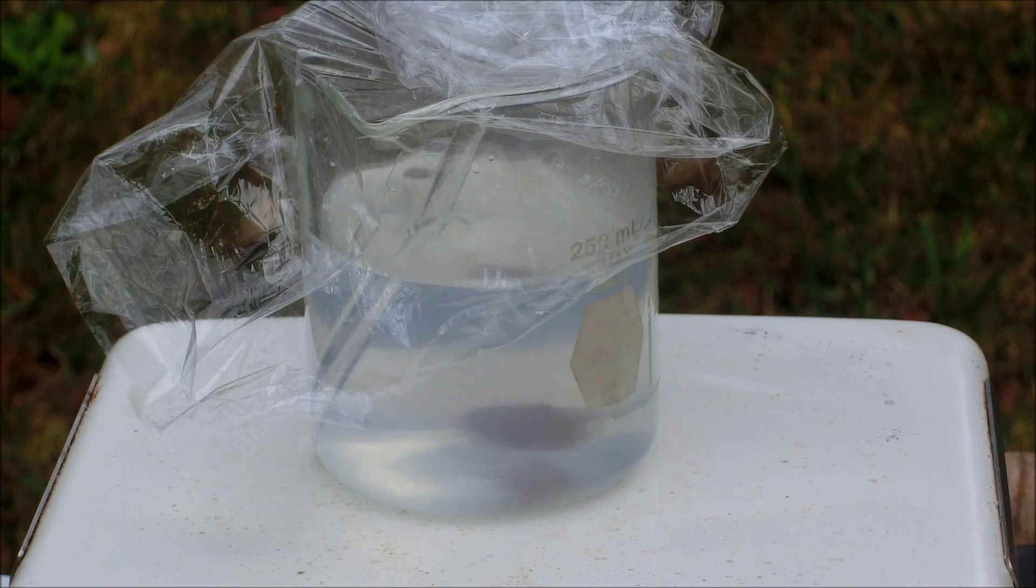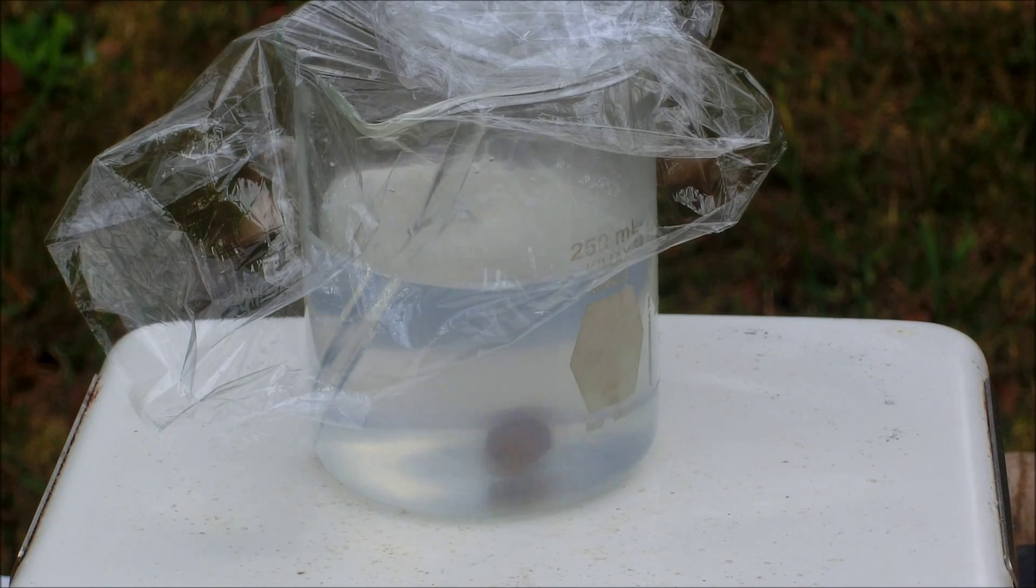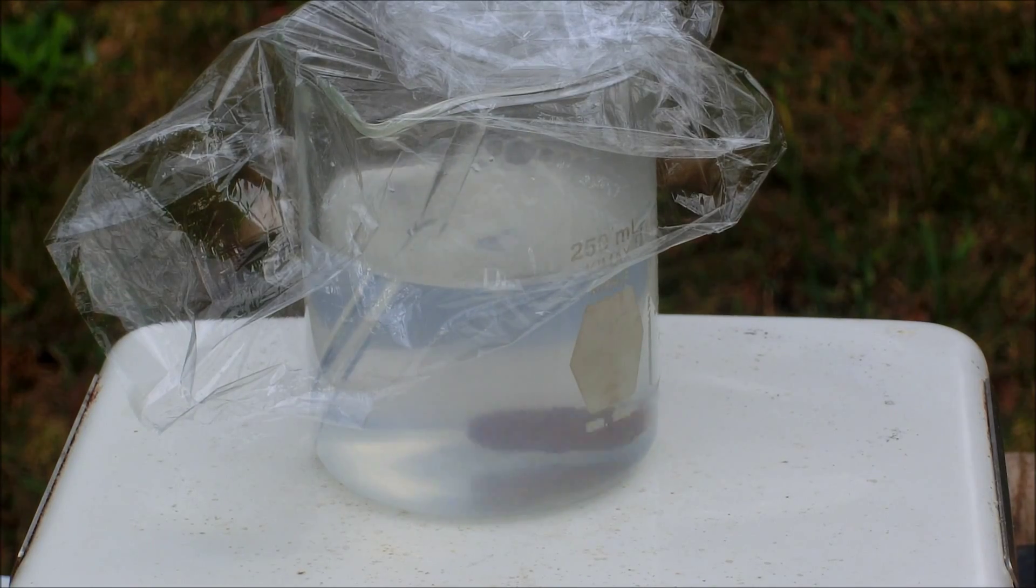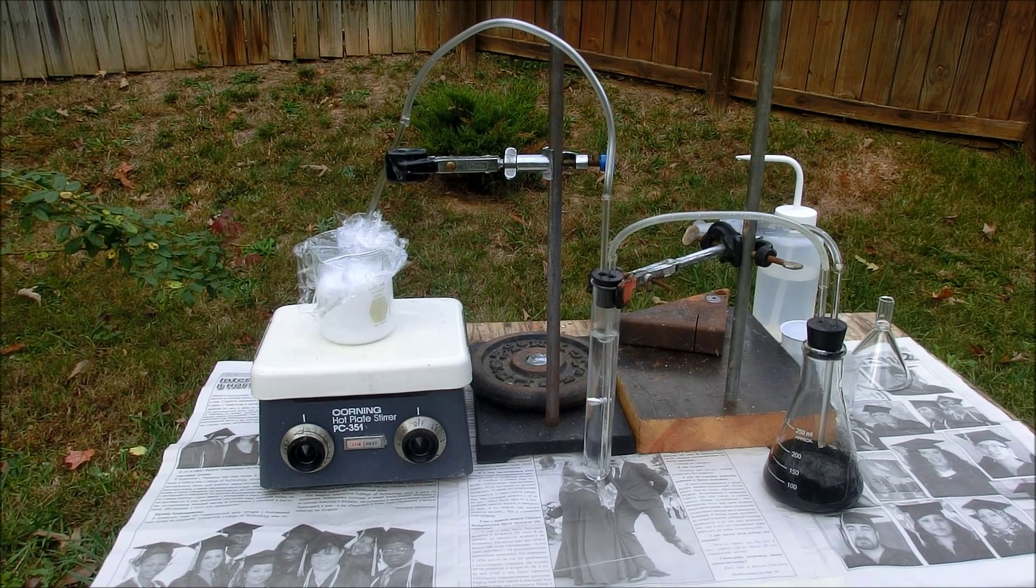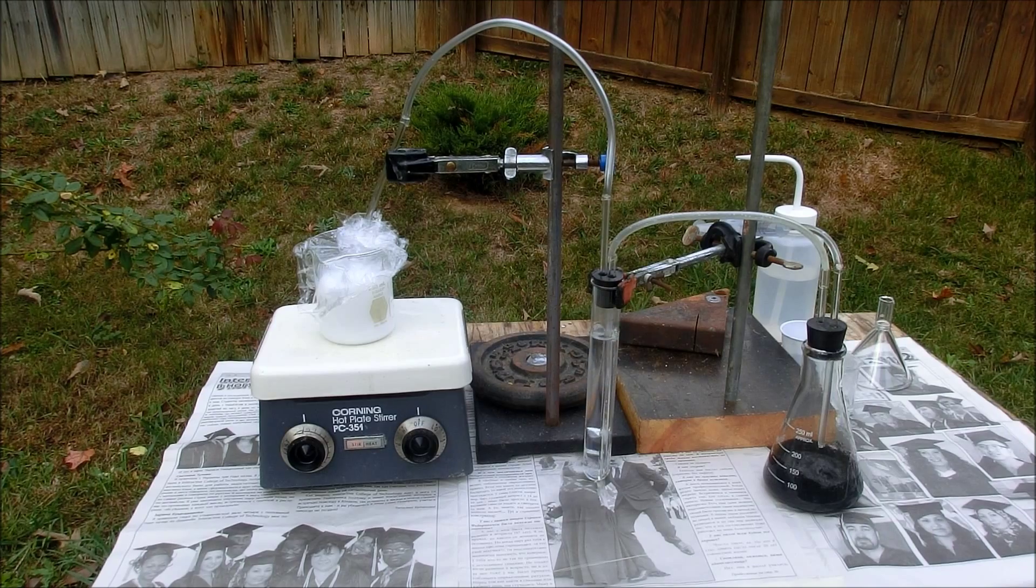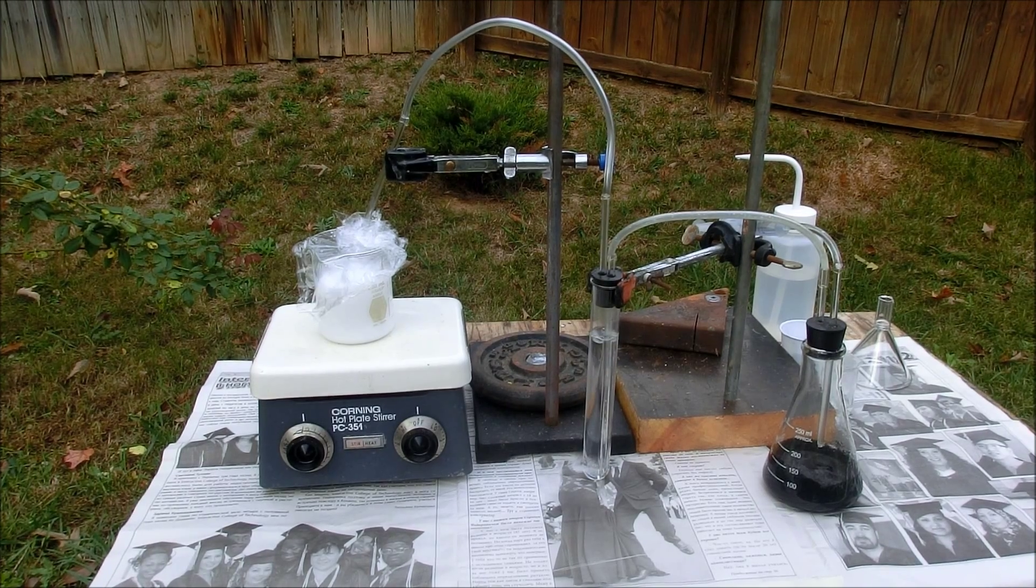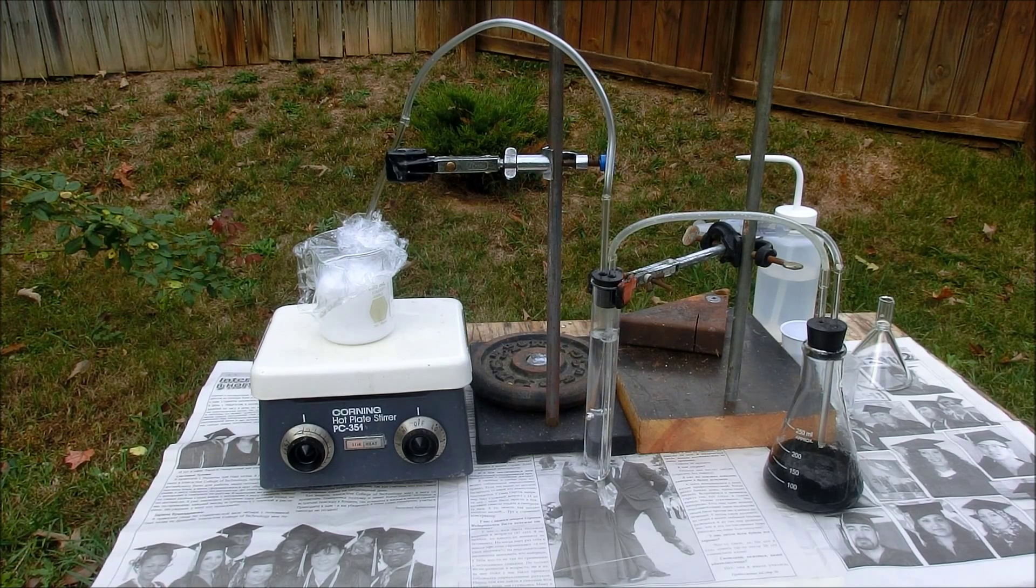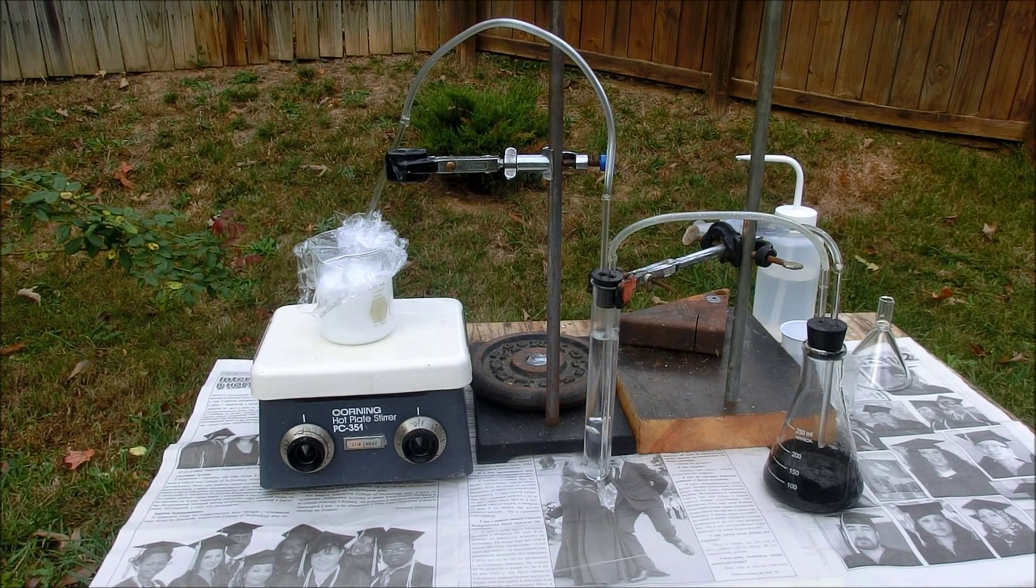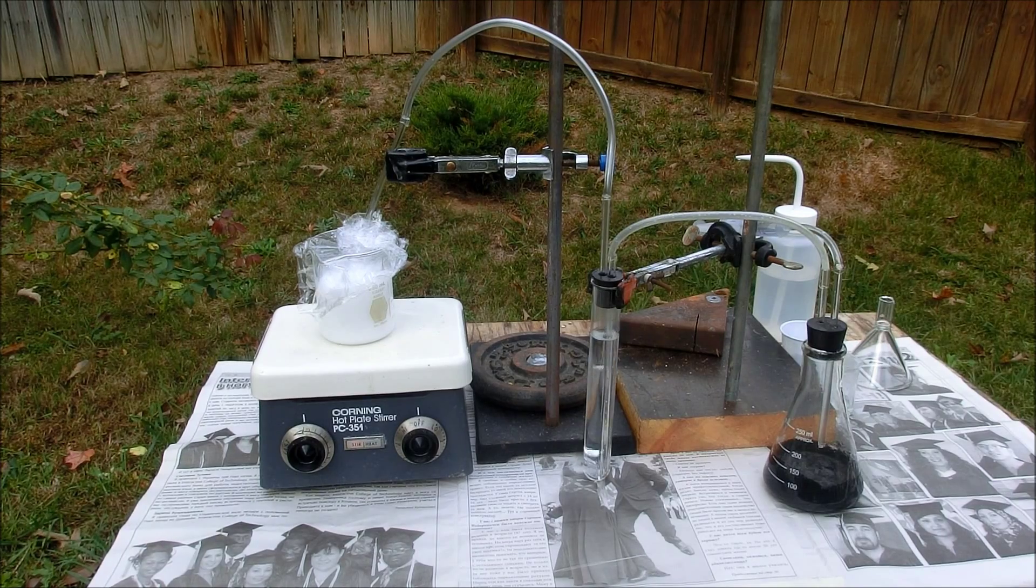As you can see, the solution is turning a little bit cloudy, so we're actually precipitating zinc sulfide now. While this is running, I should mention that hydrogen sulfide is a pretty nasty poison, and you should minimize your exposure to it. That's why we're doing this outside and not inside. It also smells terrible, the smell of rotten eggs, so be aware of that and minimize your exposure.